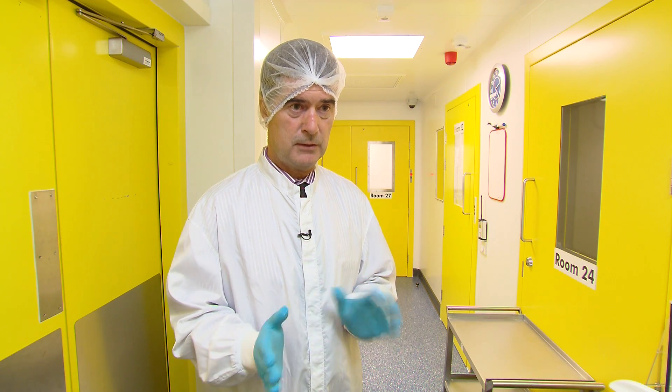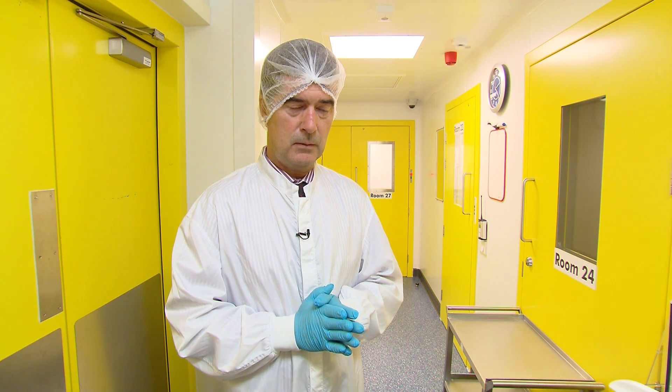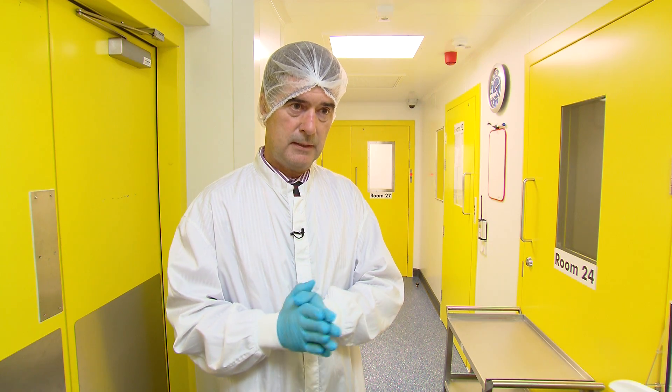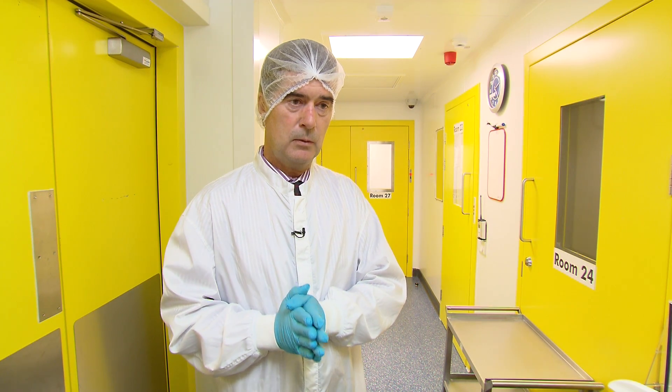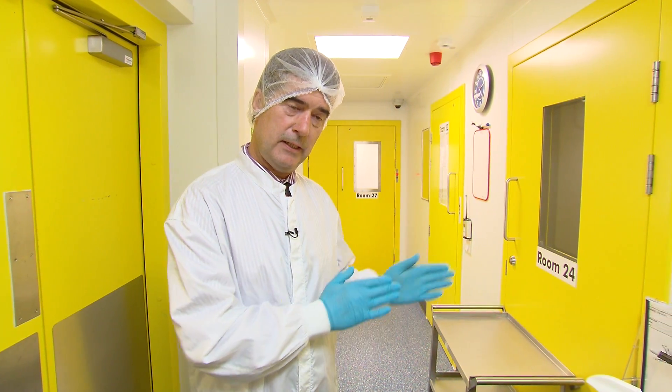This is a clean room facility with basically a 250 square metre footprint. There are two identical clean rooms, mirror images of each other. In these clean rooms we have grade A, B, C and D classifications, where A is the highest classification working out to B, C and D. Where we're standing now we're going towards D and C, then B to A.